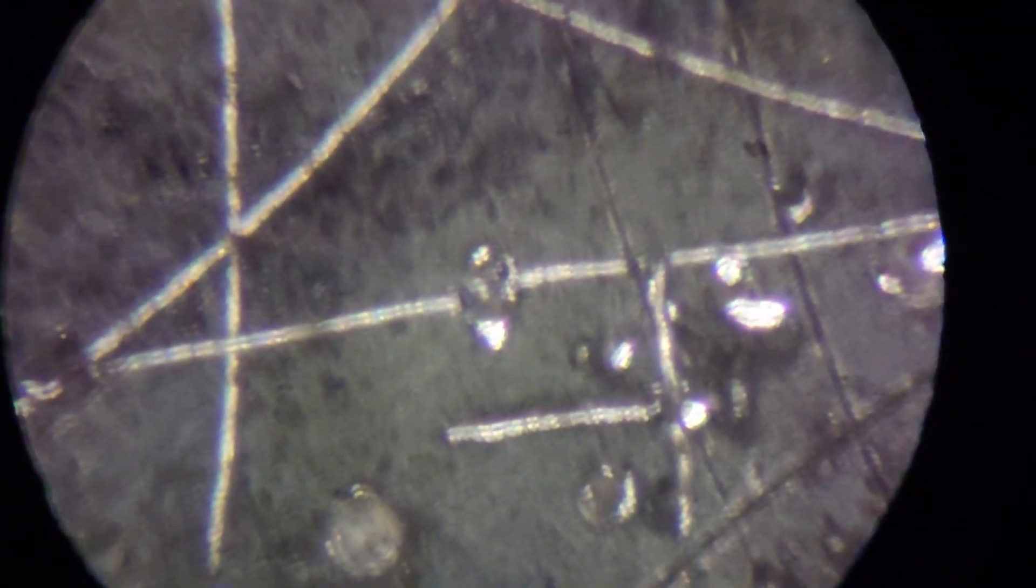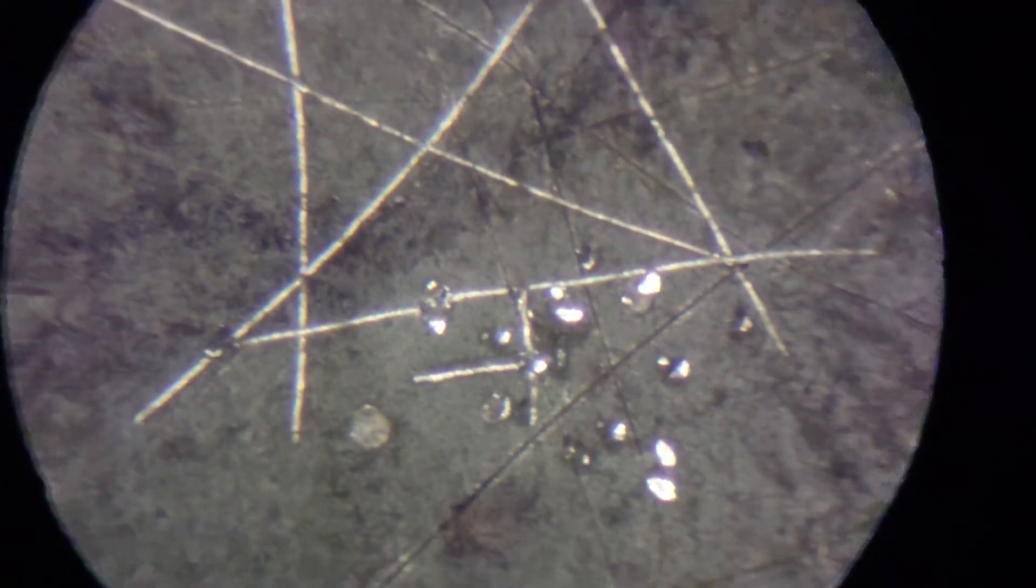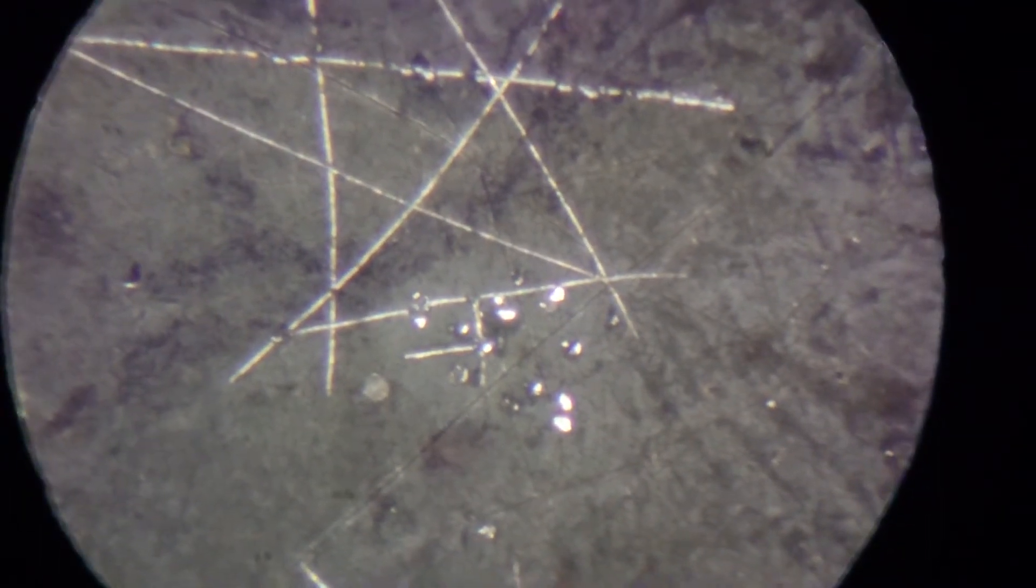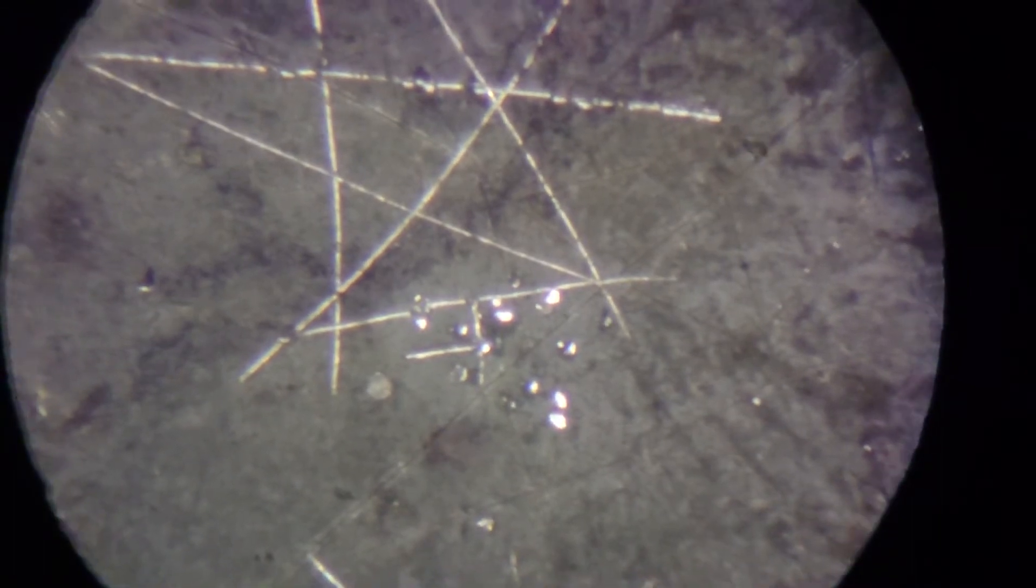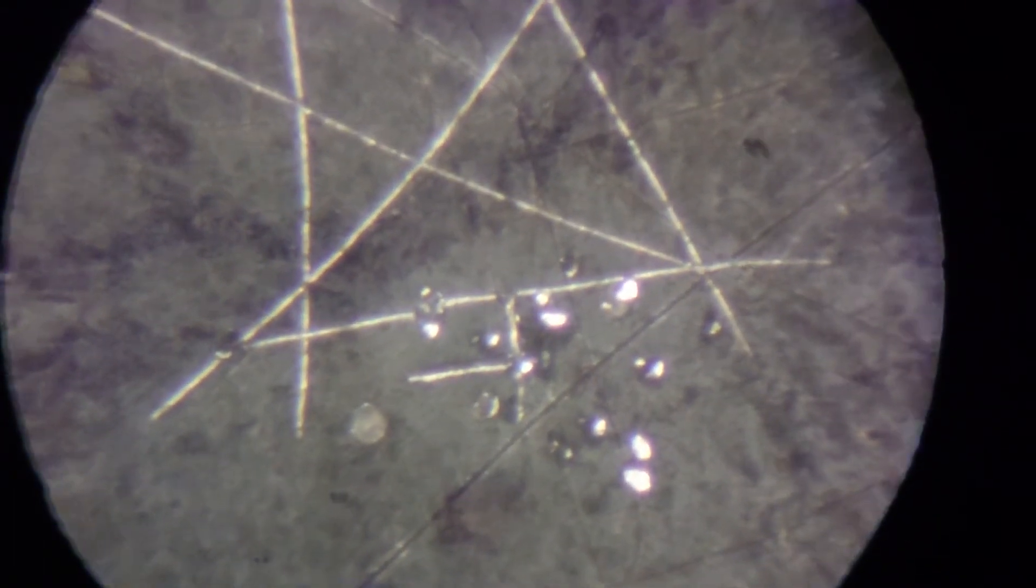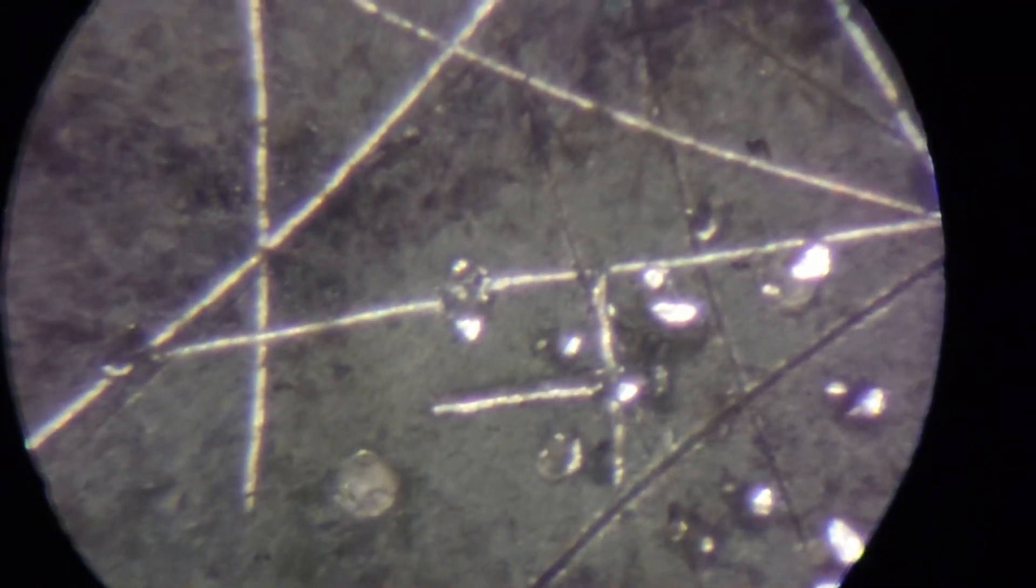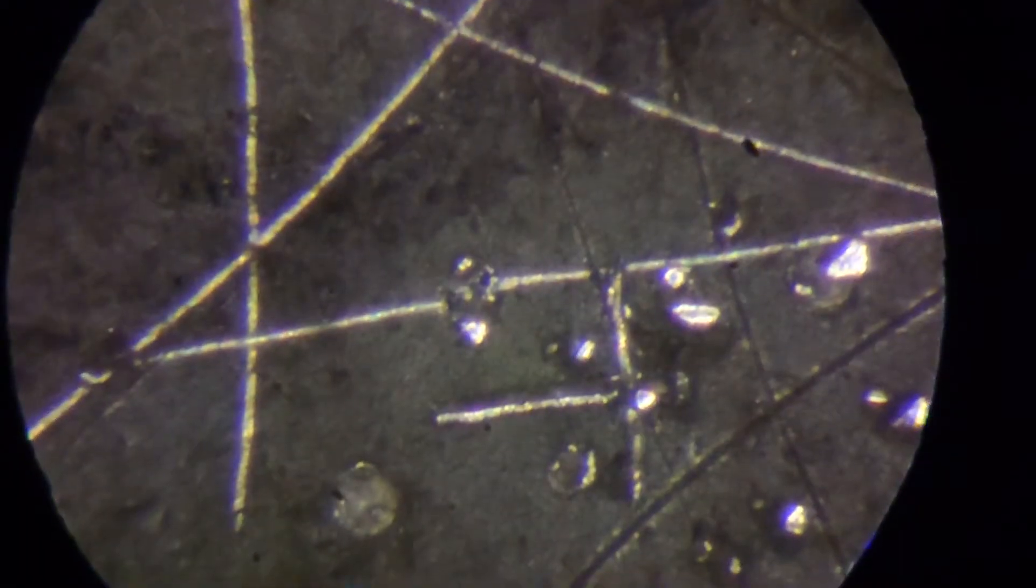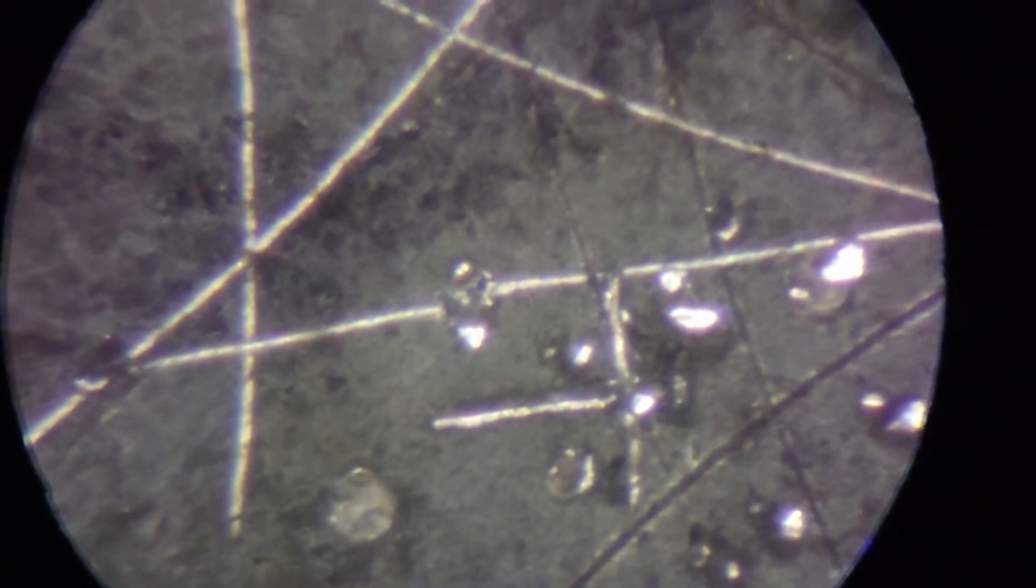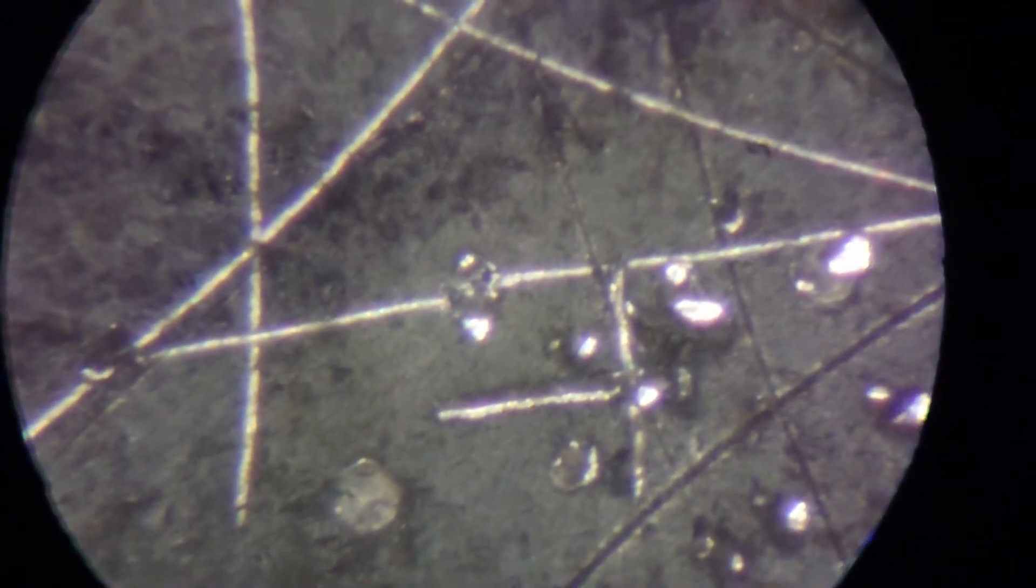Collimation is pretty nice now, no mechanical loose actions. So it's again got varnish on all its surfaces. We just need to wait until after a day - might be some collimation gets loose because varnish will pull optical parts aside.